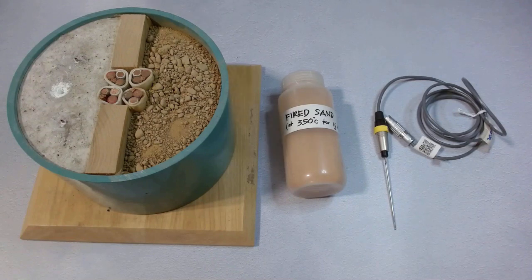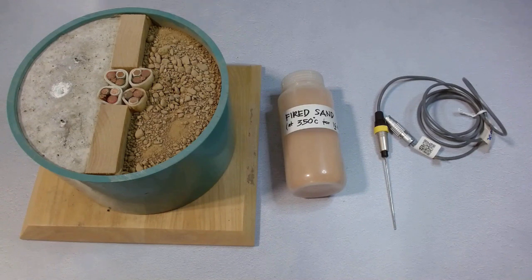In this video, we will talk about how to properly use the TLS100 needle sensor to prevent any damage to it.